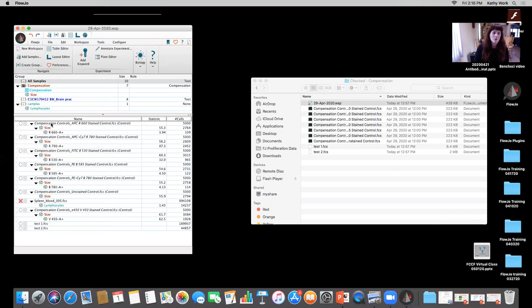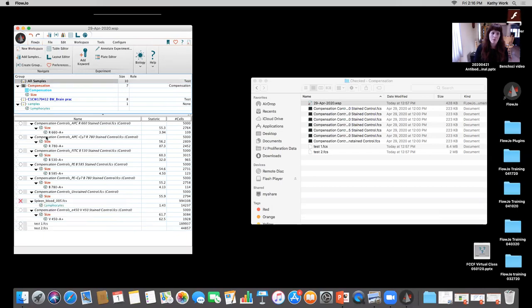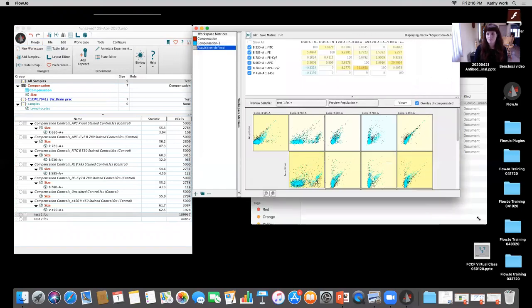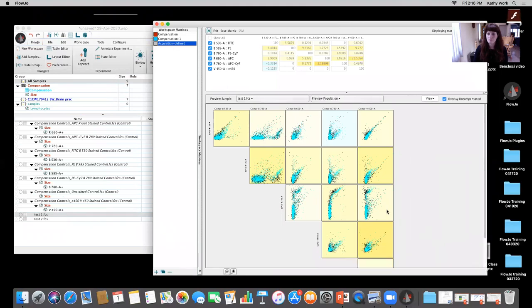So what we have here is all of the single color controls, and the single color controls are all in the comp group here. We also have our two test files, right? And this file we don't need to worry about. We don't have that in there. And if I open up that comp matrix and expand it out, I'm seeing that there's undercompensation. I'm seeing that there are issues here.